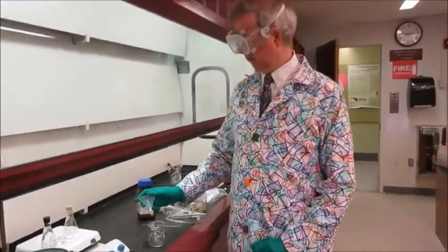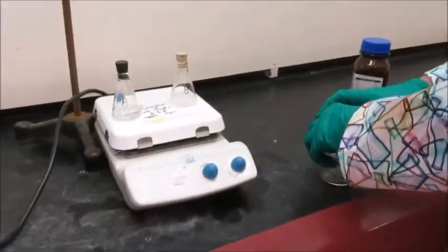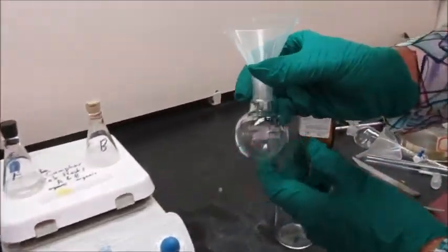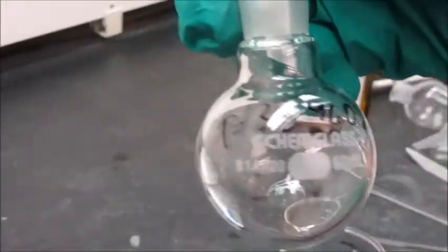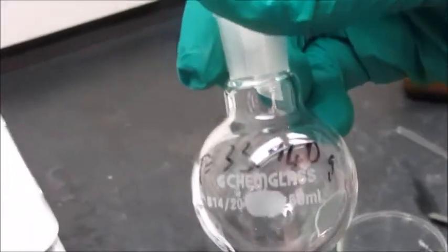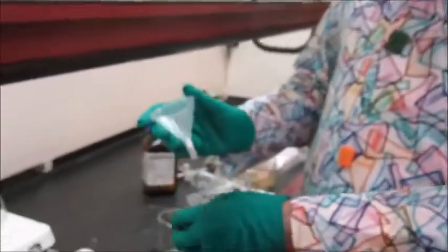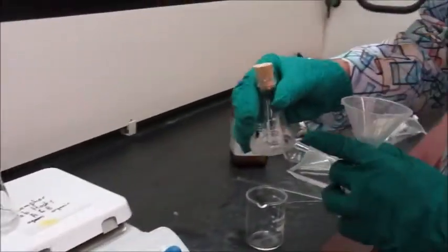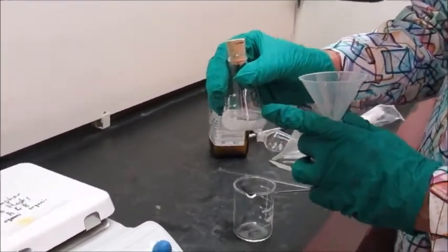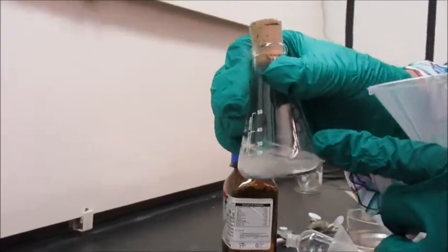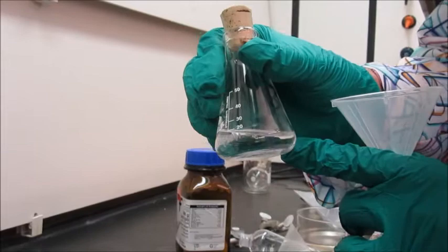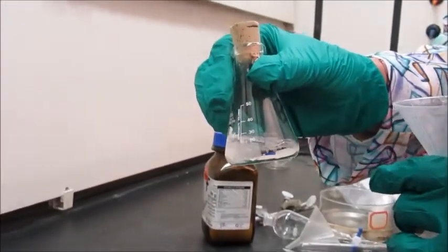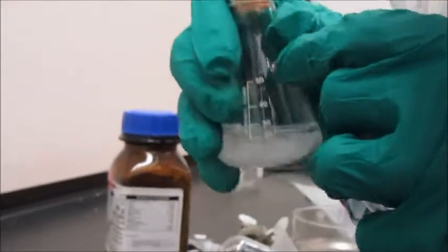Okay, so now we're ready to work up our camphor solution from earlier. I have a tared round bottom flask - you can see the mass on there, 33.940 grams. Often we just quickly pour a liquid off the sodium sulphate. This is the organic layer containing our hopefully camphor, and it's been dried overnight over sodium sulphate.